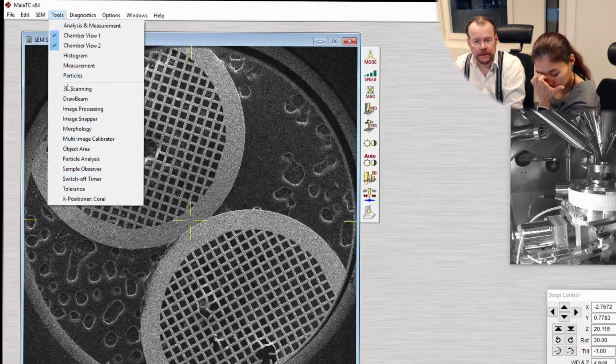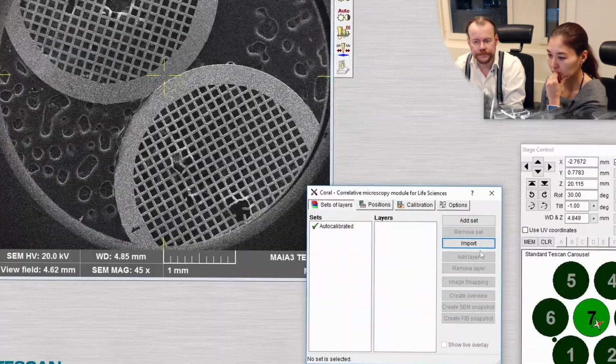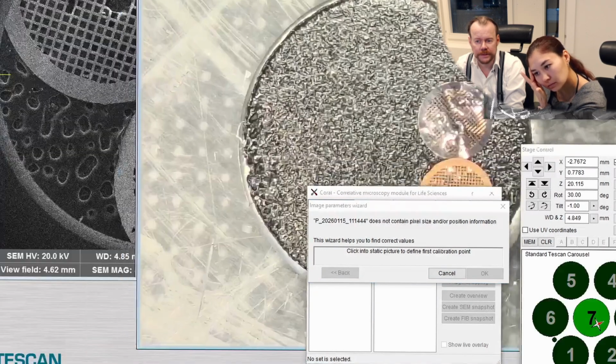we can use other information to help us navigate around. And that's the reason why I had taken a picture of this sample before we loaded it in the machine, with my mobile camera, and then I loaded it up in the machine. So there's something in tools, X-Positioner Coral here, and here we can import that image, and the image is this one. So here is my mobile camera image of the stub.